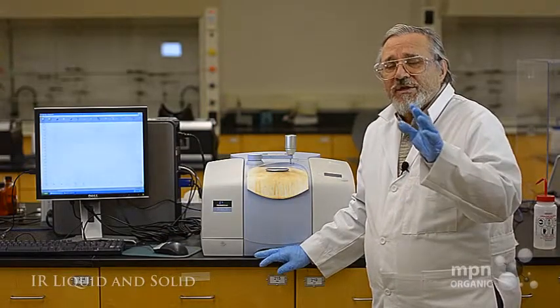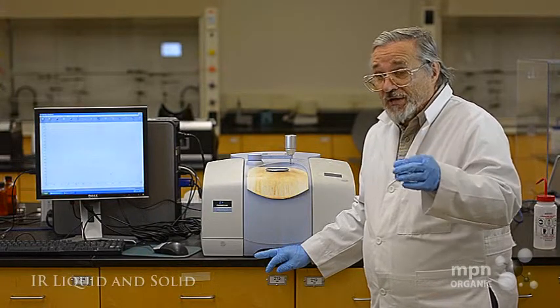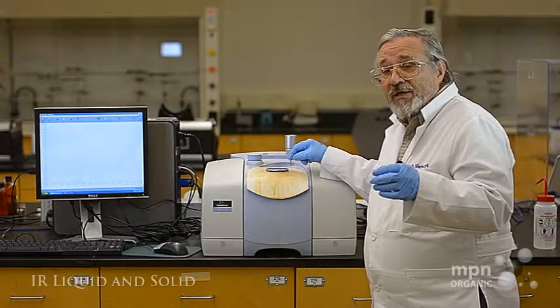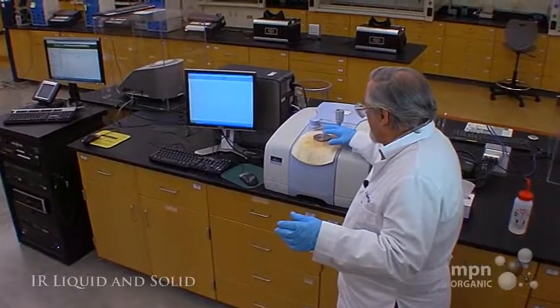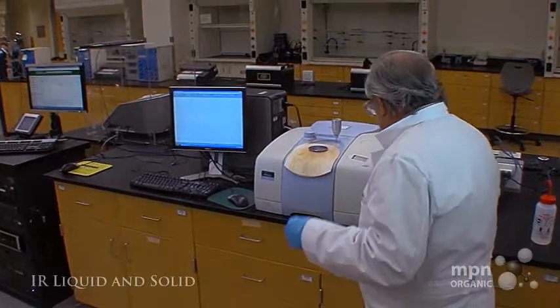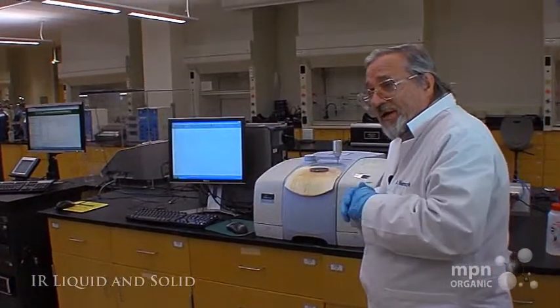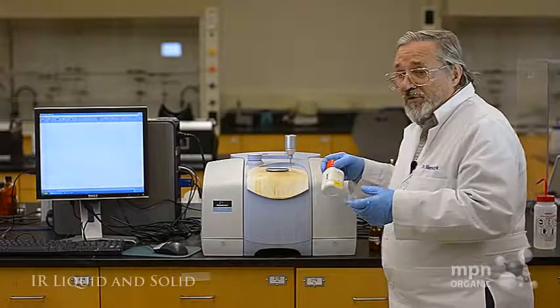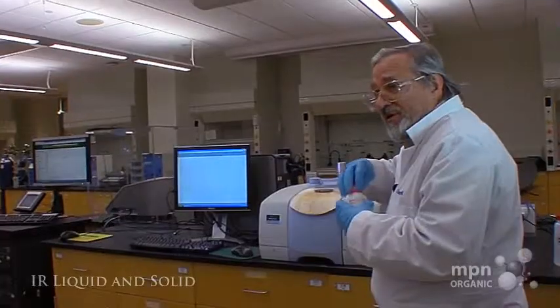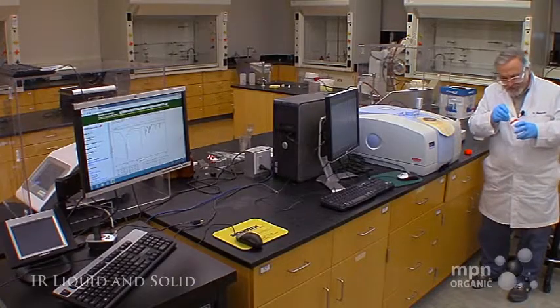Okay, you've seen me take the IR of a liquid and I explained that the difference between a liquid and a solid actually is just the way the liquid and solid gather up on the center of that disk. With the liquid, when you put a drop on there, it just spreads over it nice and evenly. But with a solid, we don't have that option. It just kind of forms a hill there, if you will.